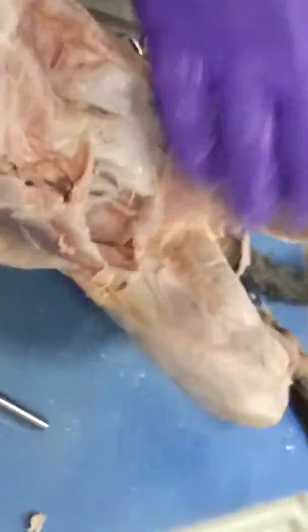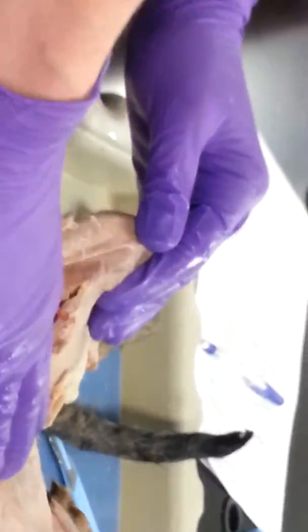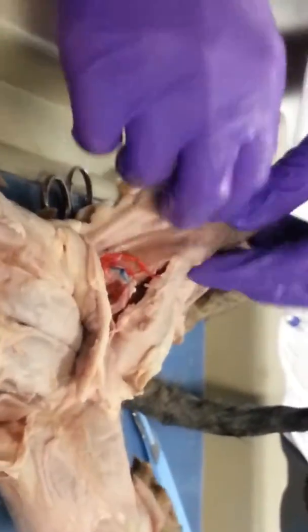So that's all except for the leg. So coming down to the leg, this happens to be a really good leg. That's a great leg. So normally we have these two muscles going to kind of cover up everything. This is garbage, don't worry about that. But this is going to be which one?